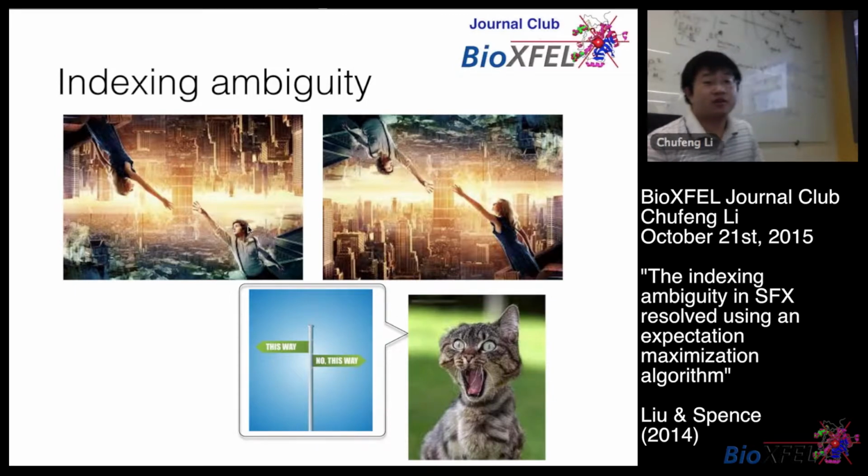So here is a very good visual example. Just looking at these 2 pictures, without further information, we don't know which one is the correct orientation, right? So what do we do? This way or this way? So basically, to solve the indexing ambiguity, we have to reconstruct or recover the correct indexing mode.